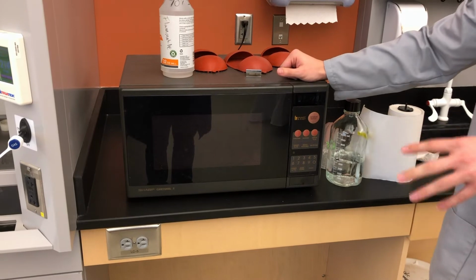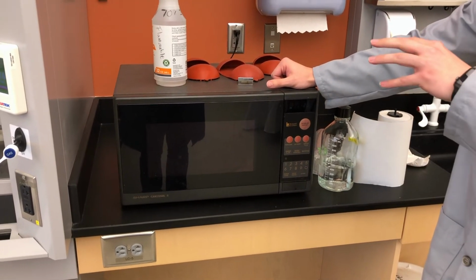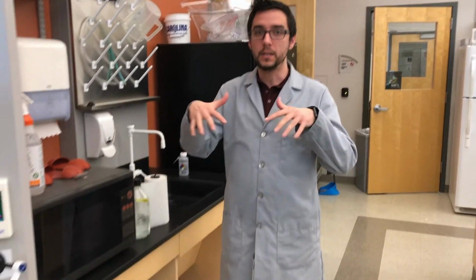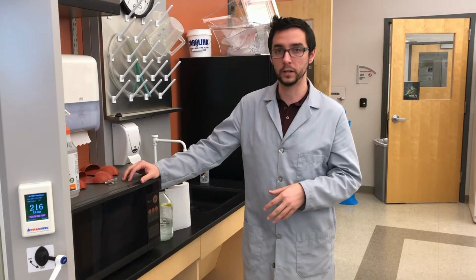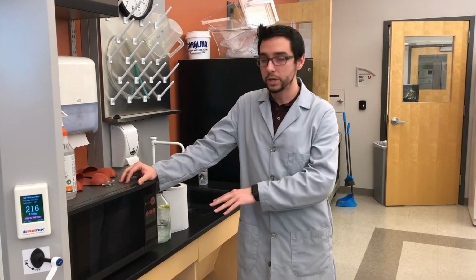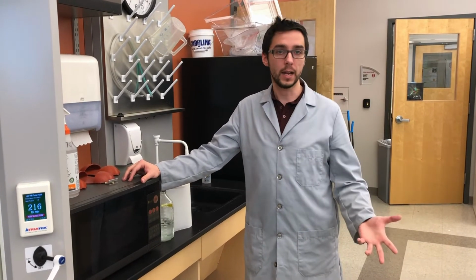So just a reminder, the process of microwaving this is we're using the heat generated here to help drive that dye deeper into the endospore so that then it is trapped within that endospore structure. Without applying heat in this manner, that dye is going to simply sit on the outside of the endospore structure, and when we wash it off here in a moment, it'll all wash away and we'll have nothing staining the endospore.